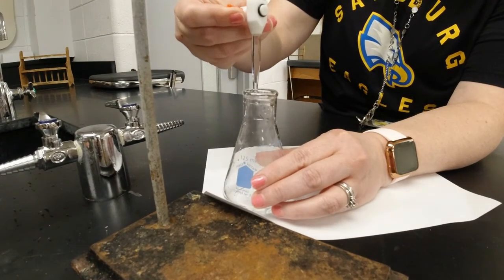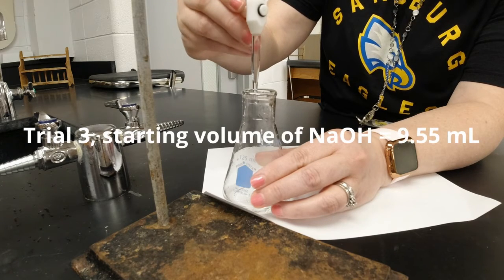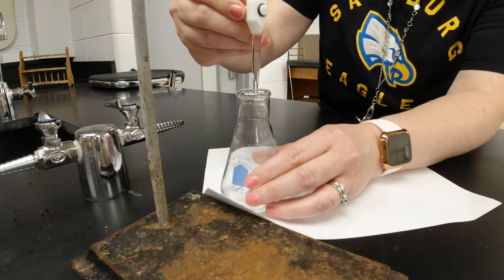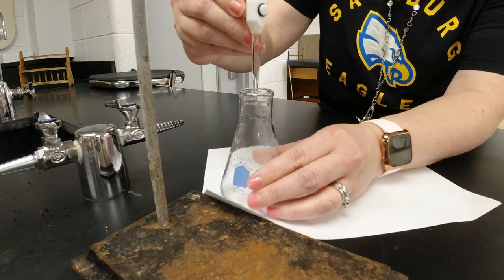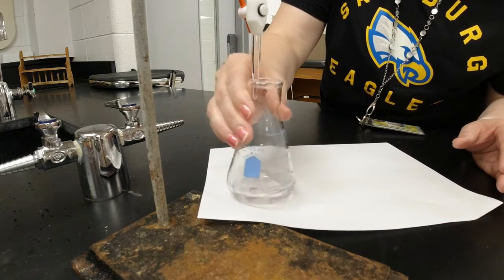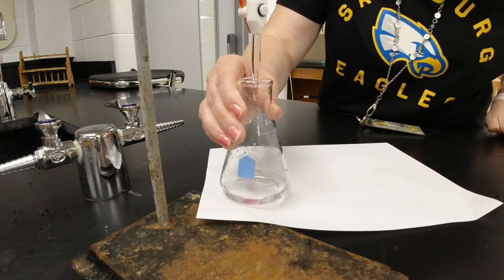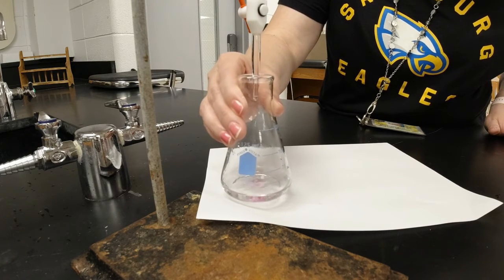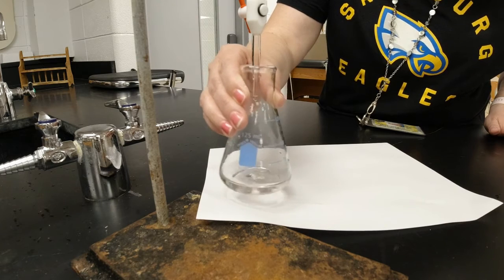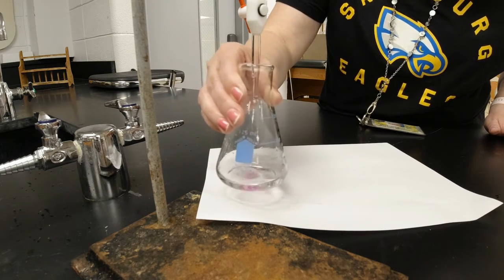And now that both of us have done this before, we've got a good idea about where it's going to turn pink here. Ooh. Okay, so yeah, it takes a little practice here. There you go. I'm going to watch over here to see about when you get close. Okay. If you guys notice, each drop turns pink, and then it disappears as she's swirling it.